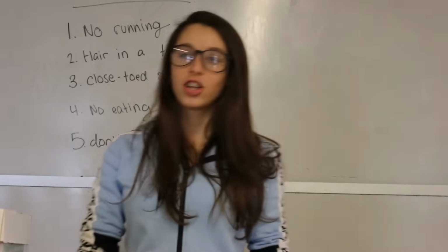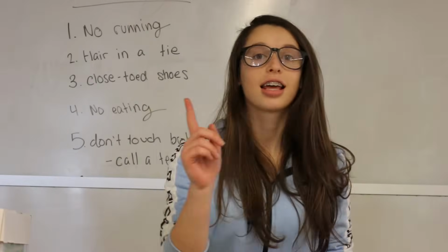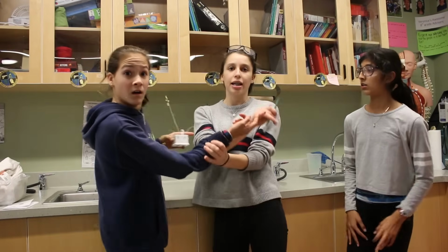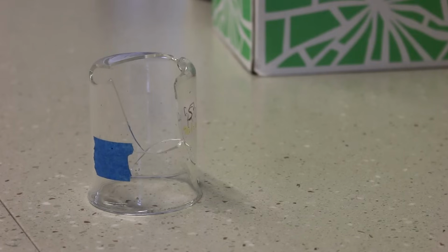There's no running in the lab. Be careful, don't get stabbed. Don't touch that broken glass. Here at school, lab safety's cool.